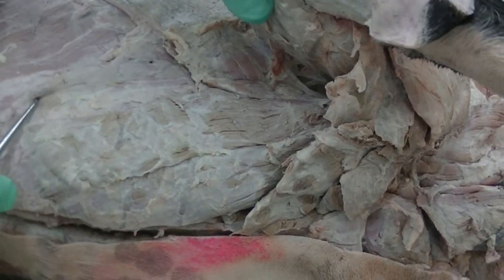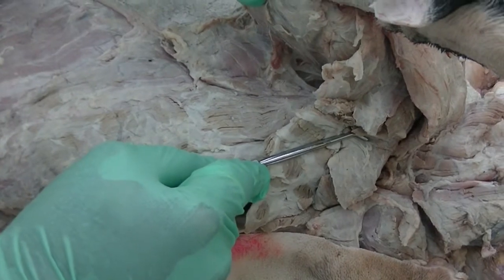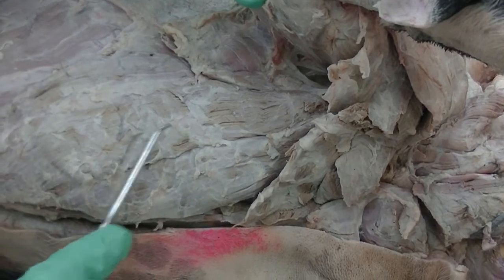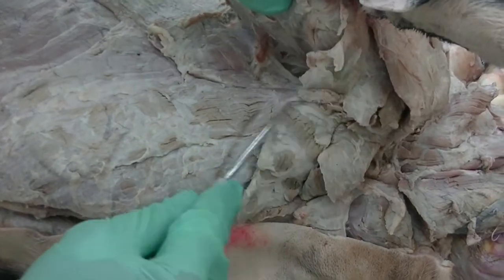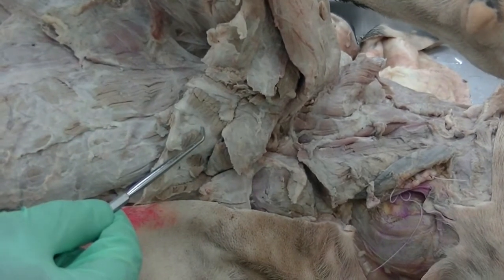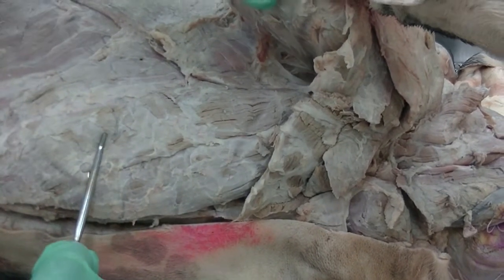The muscle seems to be much more widespread, much more bulky, but as it comes more cranially, it is covered by the superficial pectoral muscles, and so this muscle is also called ascending pectoral muscle or deep pectoral muscle. So in order to differentiate between superficial pectoral and deep pectoral, descending pectoral and transverse pectoral combined would be called superficial pectoral, and ascending pectoral alone is called deep pectoral.